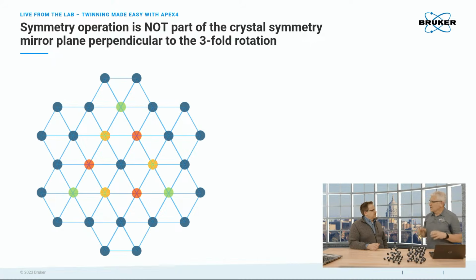So you see the diffraction pattern, the positions are the same, but the intensities are wrong. And typically that makes it very difficult to solve and refine the structure. So these twins are called merohedral twins because all the spots overlap.